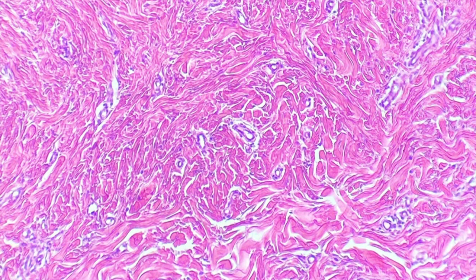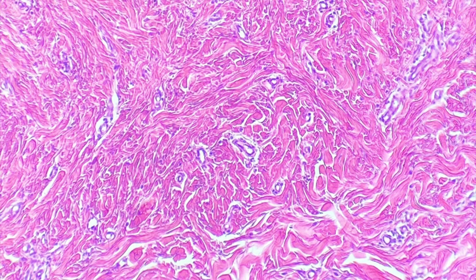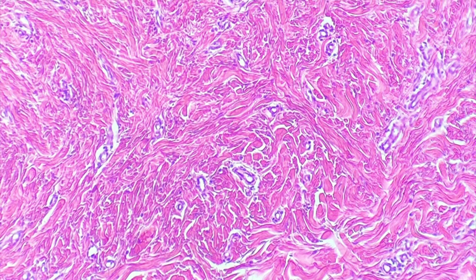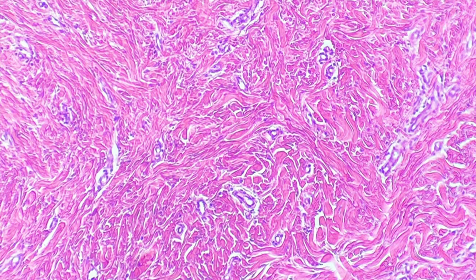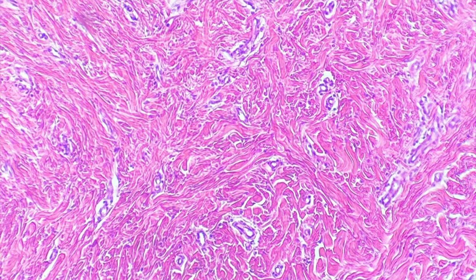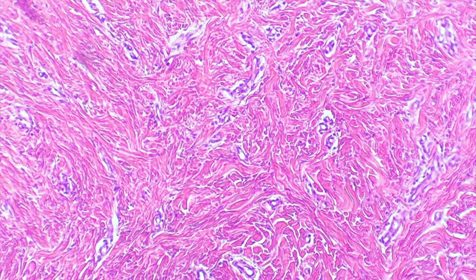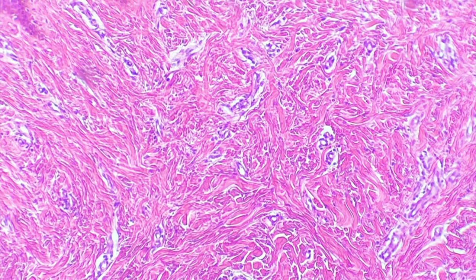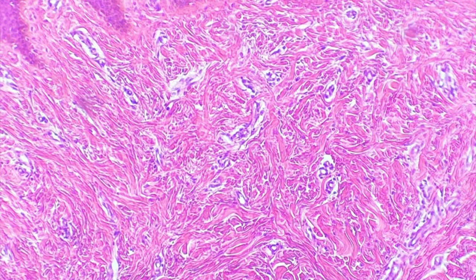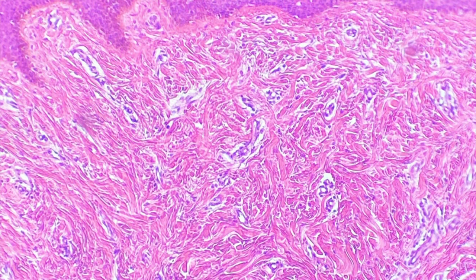Hello YouTube, and welcome to this second microscopy video. What do you think we are looking at here? It's plainly very beautiful, and it is part of the human body, but I'm going to leave that a mystery for now. Take your best guess as to what you think you're seeing here — it looks like a piece of art, but it's really just some cells stained with pigment under the microscope.